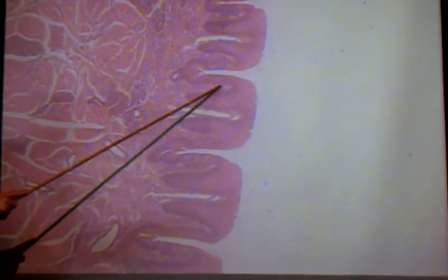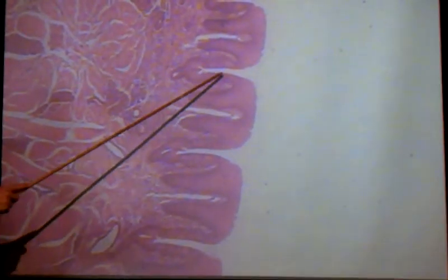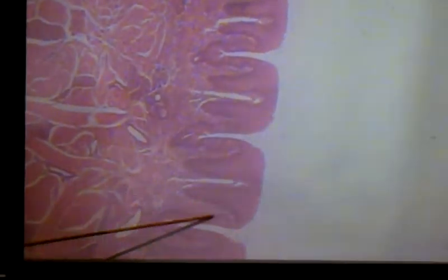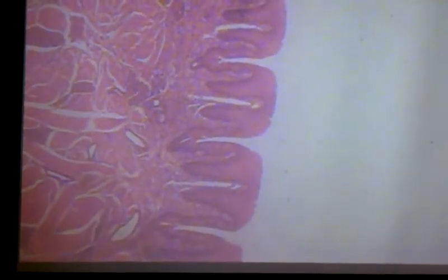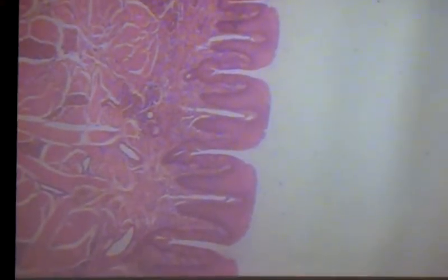Again, mine aren't stained very clearly, but hopefully on your slide they are. But they're on the sides of the papillae, excuse me. So when we zoom in on those, what we will see is that an individual taste bud is actually composed of many, many cells.